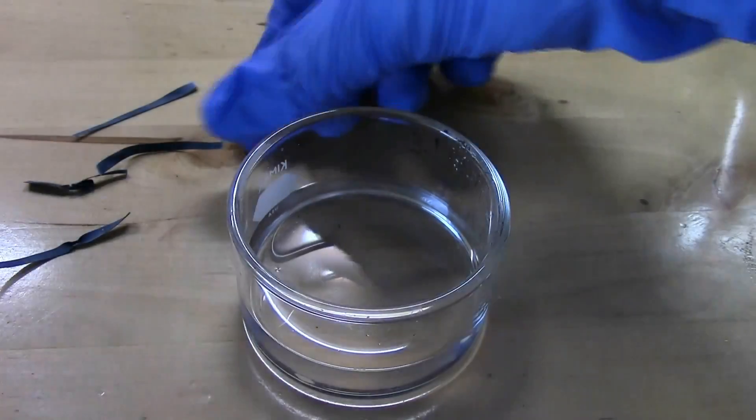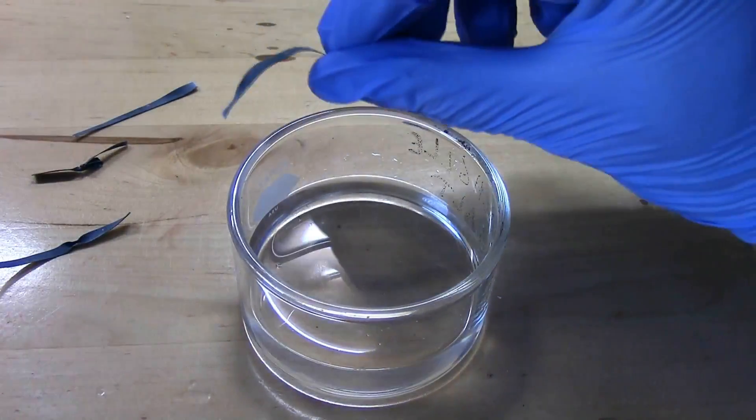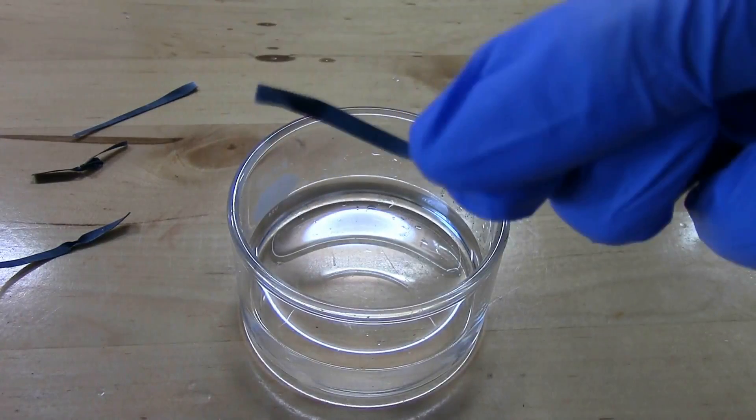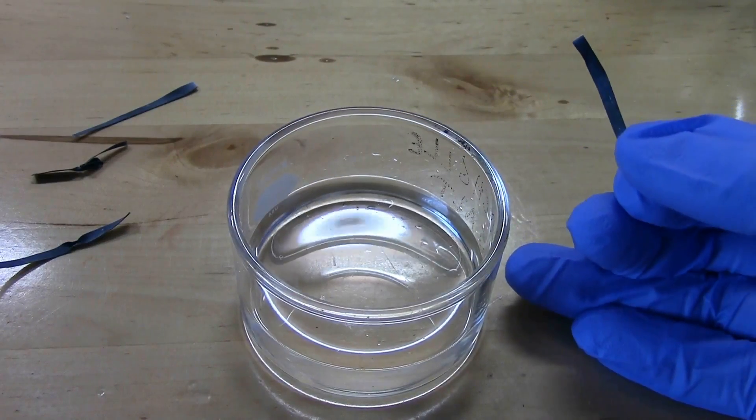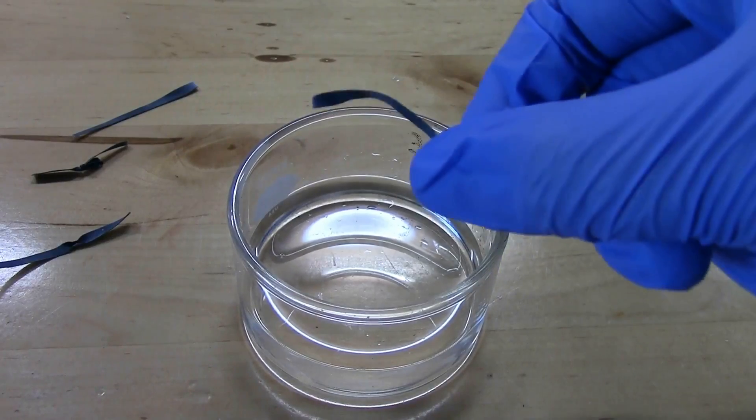So let's test these again. These are some of the strips that I recovered that I left out a little bit so they're very oxidized and this is just some distilled water with a little bit of phenolphthalein indicator and we'll drop it in and see what happens.